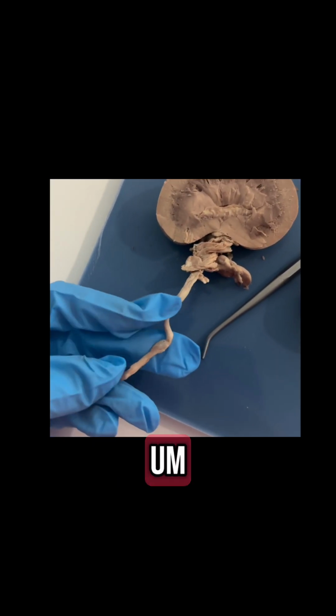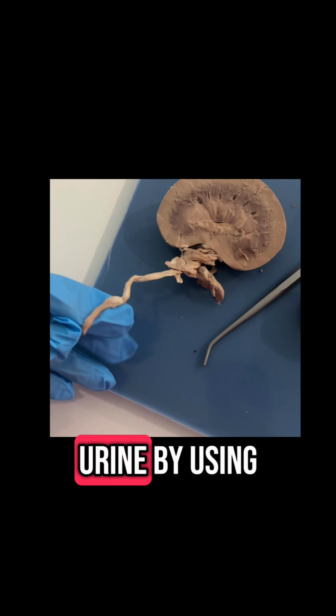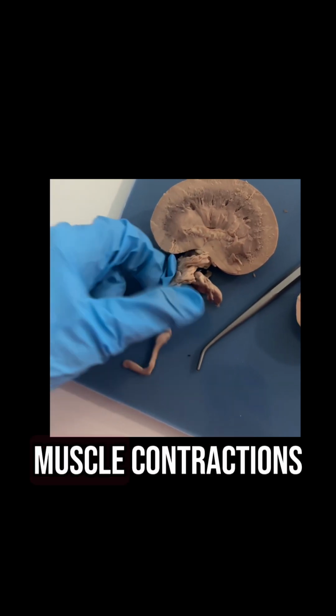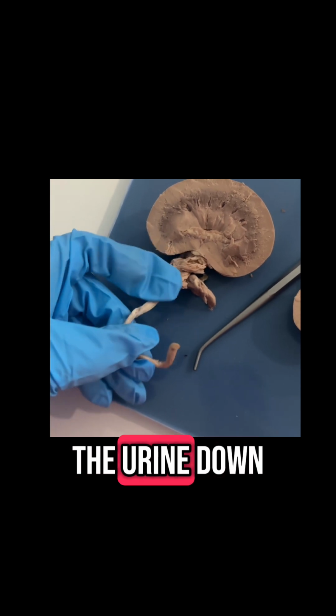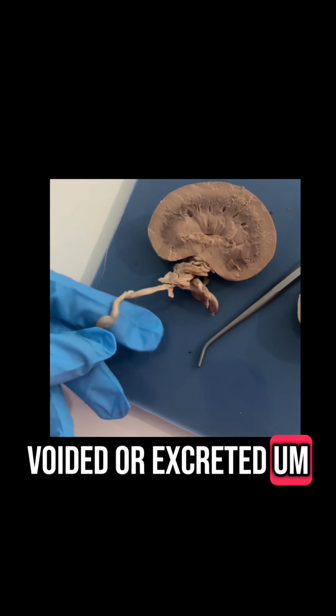Okay, so right here I have the ureter. This is a tube that connects the kidney to the urinary bladder, and it moves urine by using muscle contractions. It pushes the urine down into the bladder from the kidney for storage until it's ready to be voided or excreted from the body.